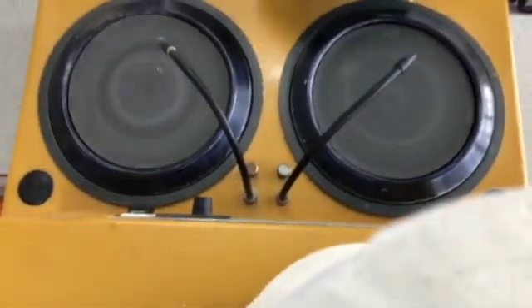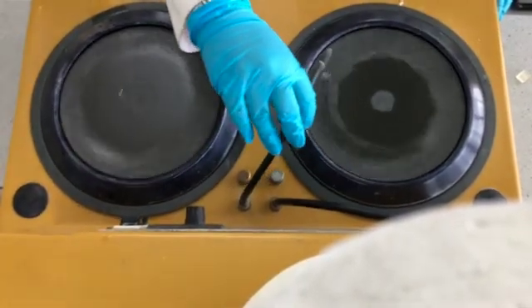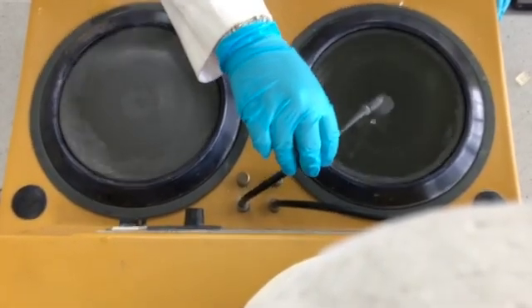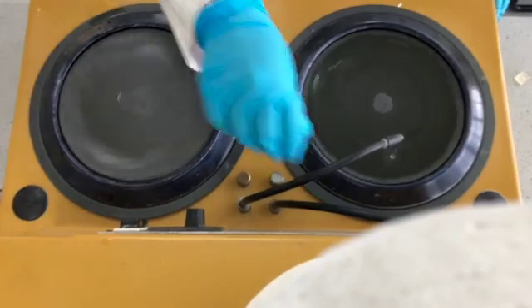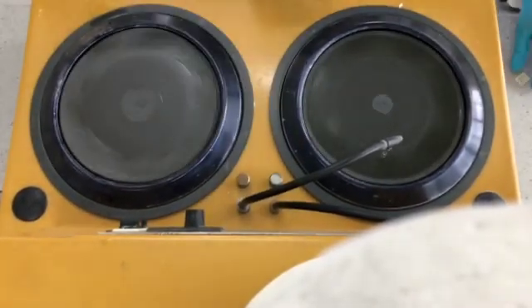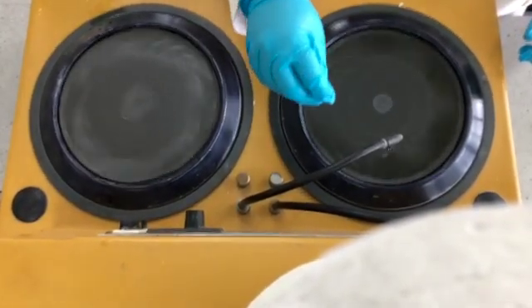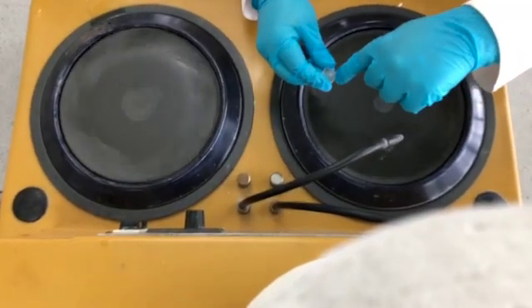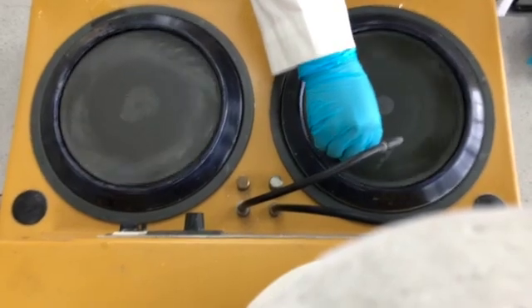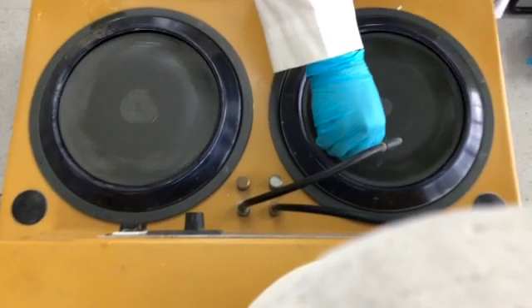Now what we're going to do is turn the water onto the grinder section and grind down the adhesive until we actually reach the paint sample. The reason we are doing that is to make the cross section visible to us, as at this current moment it's not possible to see it because of the adhesive. So we will grind down the adhesive until we reach the paint sample.